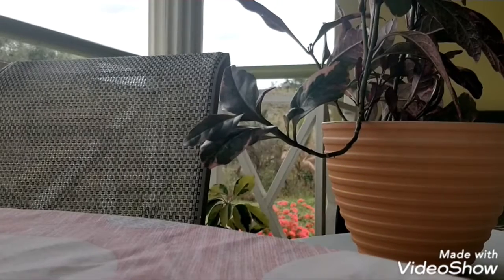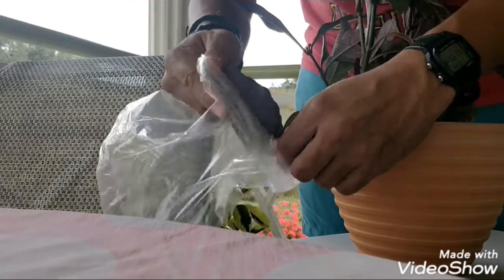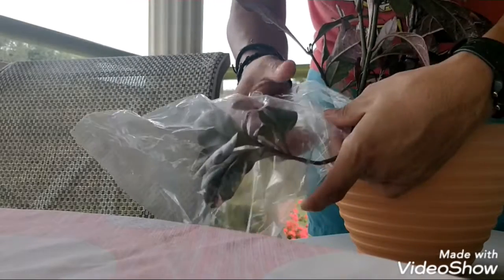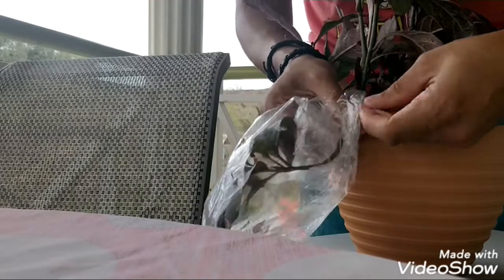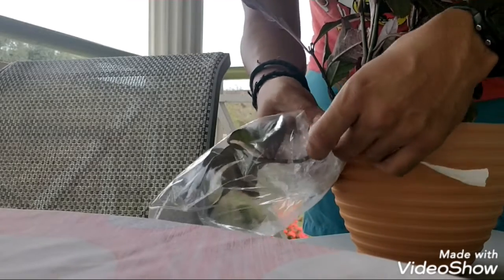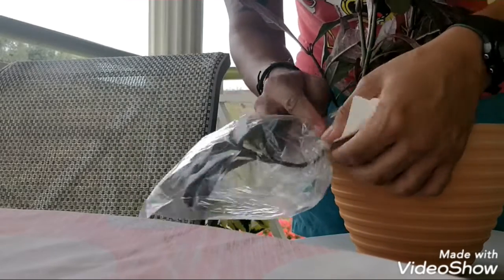What you want to do is take the plastic bags and put them over and around so that some of the leaves go into the bag. You want to get this done as carefully as possible — you don't want to damage the plant too much. Then you're going to make the top of the bag sealed off as best as possible, using masking tape to wrap around it and keep it trapped inside, so it's as airtight as it possibly can be.